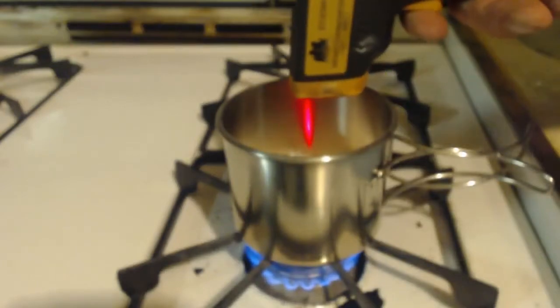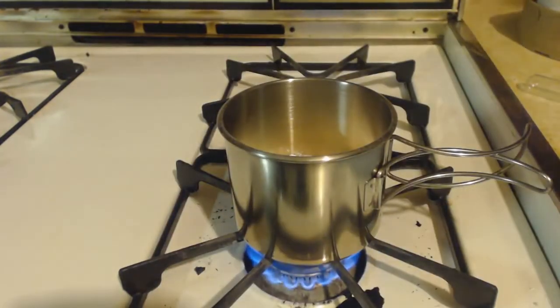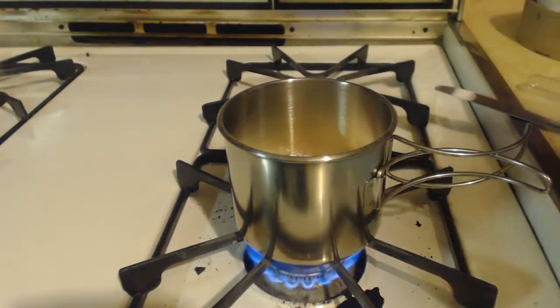167, 174, 165. Well, I'll bring you back when it starts being hot enough, and then I'll light a match, hopefully, and it'll go out.